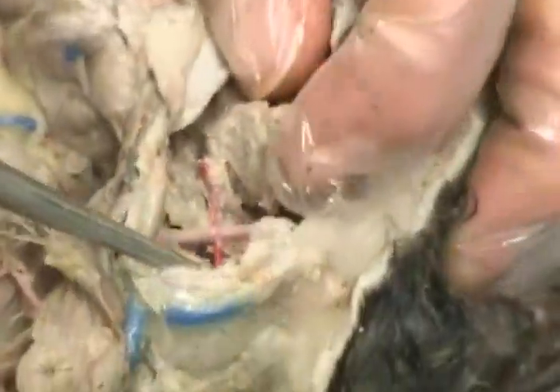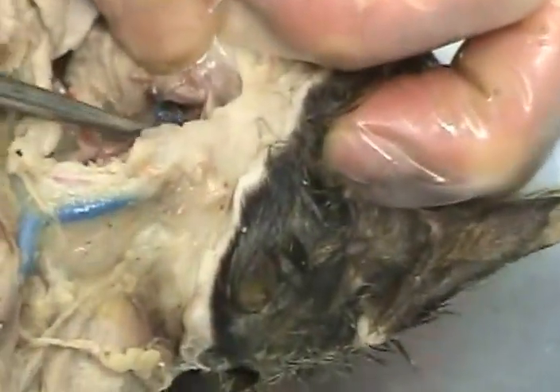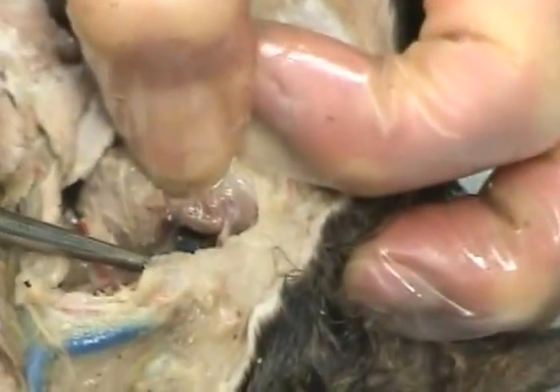So the middle one's external? On this cat, yeah. Okay. And then the next farthest branch up here is external maxillary and internal maxillary. In the ribs is intercostals. You even have blue and pink in yours.